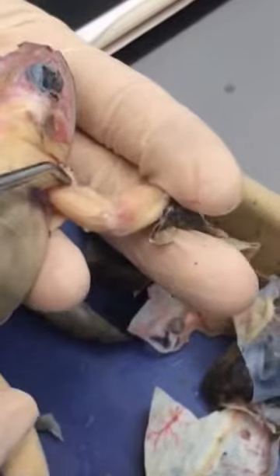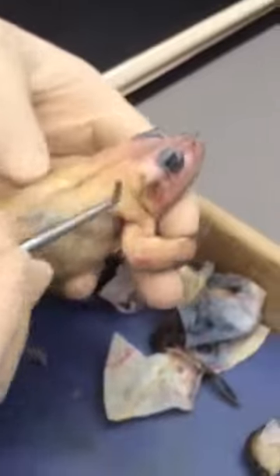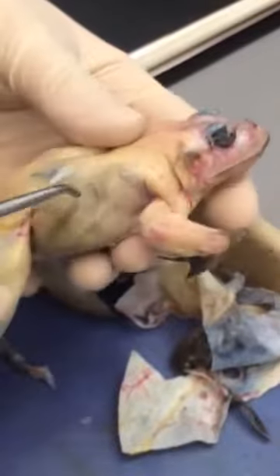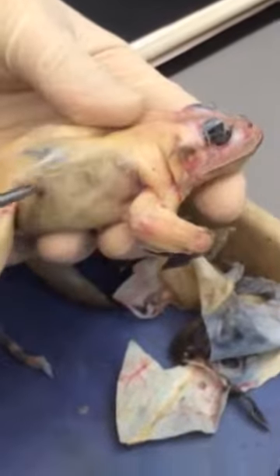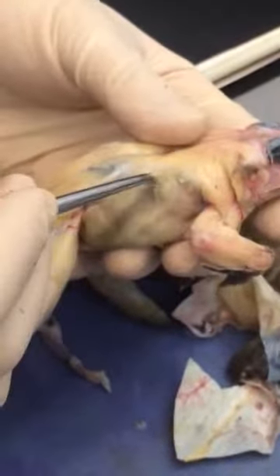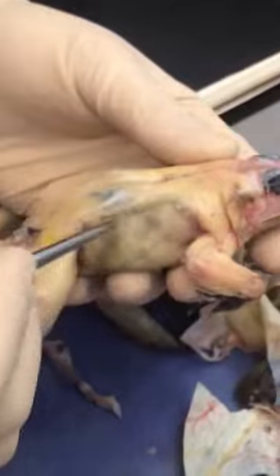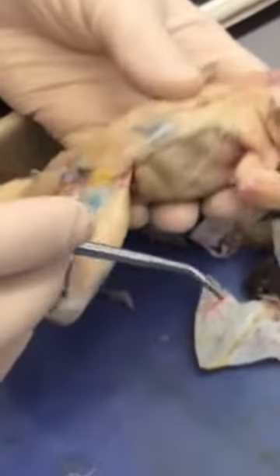Right there, see that — anconeus. You've also got latissimus dorsi, which is this one right over here, and then external abdominal oblique, which is this thing over here.